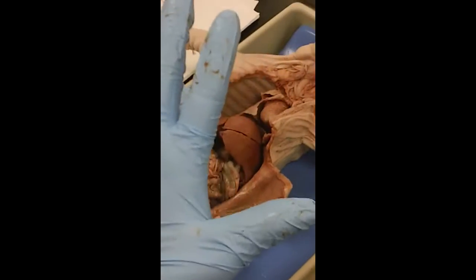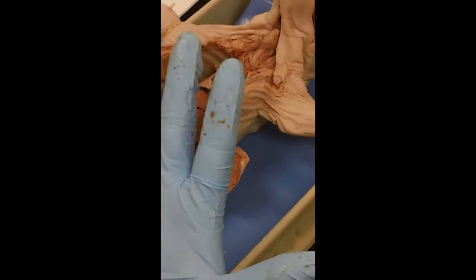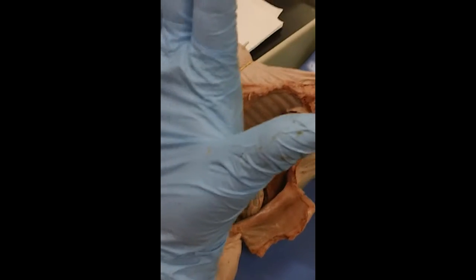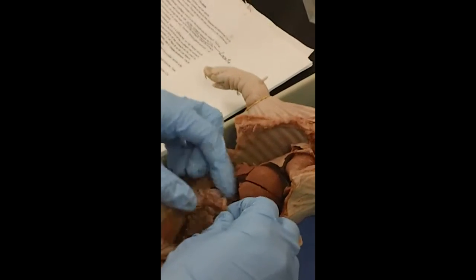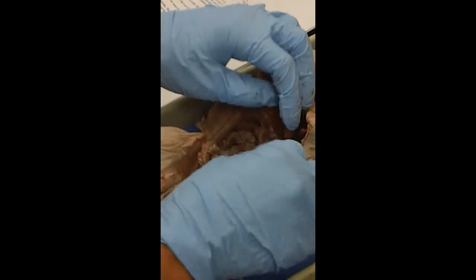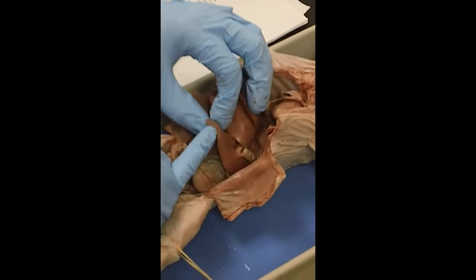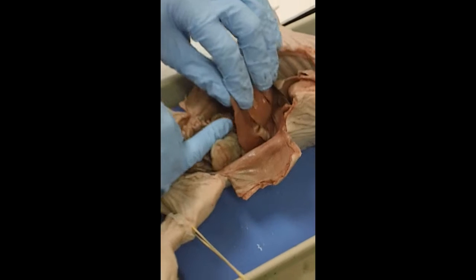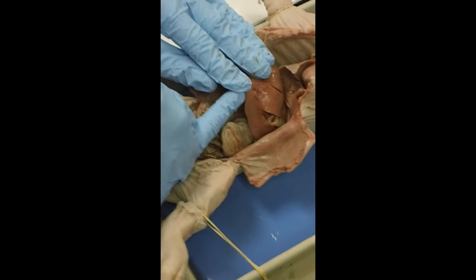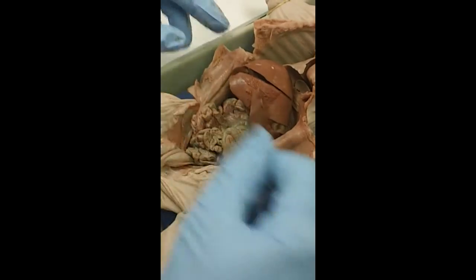The small intestine, I should mention, is lined with tiny finger-like projections called villi, and they increase surface area. Instead of being flat, it makes the inside be these tiny microscopic fingers, and in the fingers are your capillaries, and that increases surface area so you absorb more nutrients from the food that you eat. And so that's the digestive system. This right here in the abdomen, I think it looks like a flattened pinky. This is the spleen, and the spleen removes your worn out red blood cells from your body.